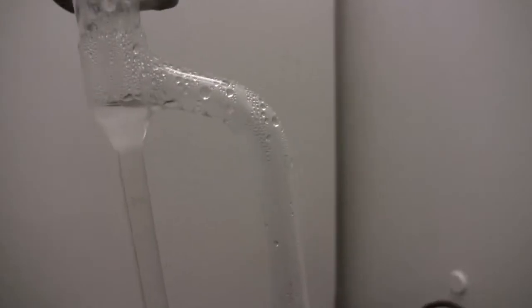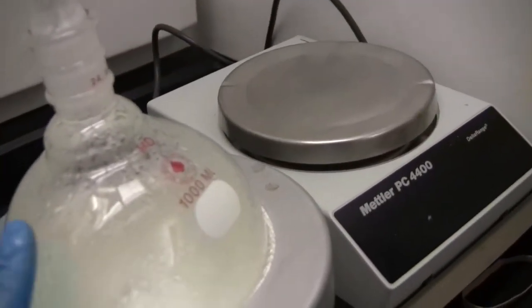We keep this going for a long time until all the water and oil inside my core are already outside my core. The water is here, the oil and the toluene are going down into my flask, and only the toluene is evaporating back and cleaning my core.